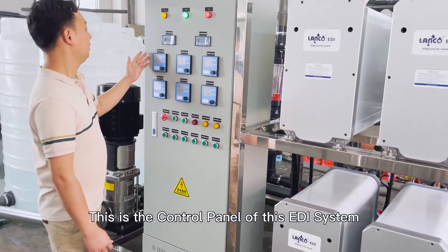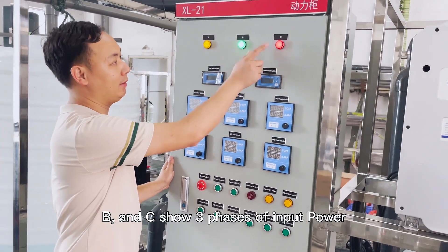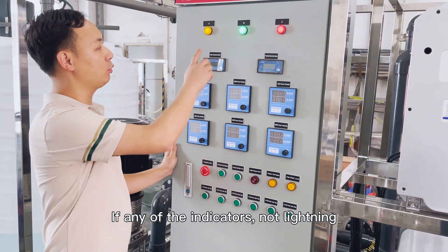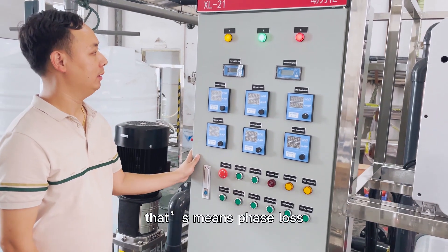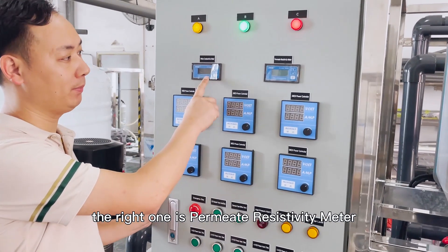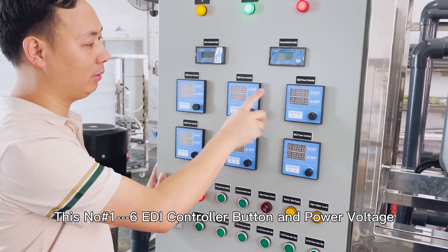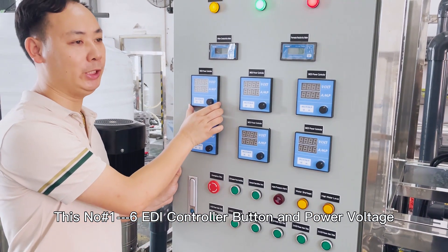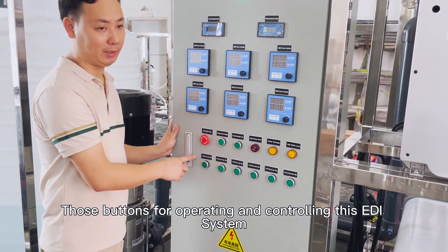This is the control panel of this EDI system. The indicators A, B, and C show three phases of input power. If any of the indicators are not lighting, that means phase loss. This is the input water conductivity meter. The right one is the permeate resistivity meter. These numbers 1 to 6 are EDI control buttons and power voltage.